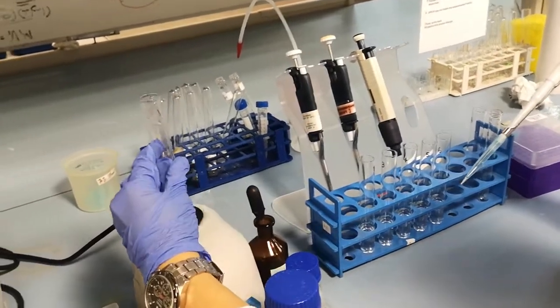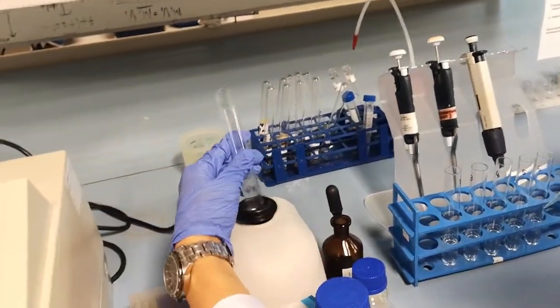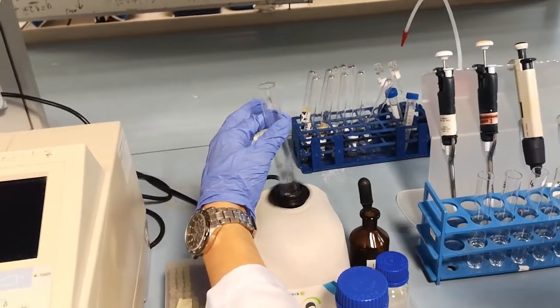Mix the solution well and leave it to settle. Label this test tube as 1.